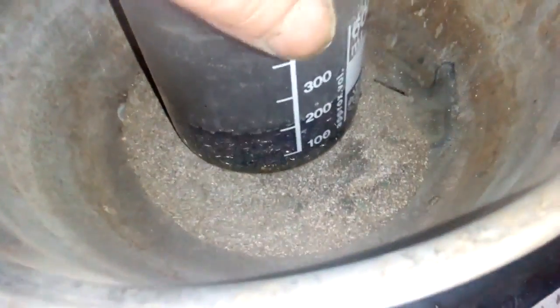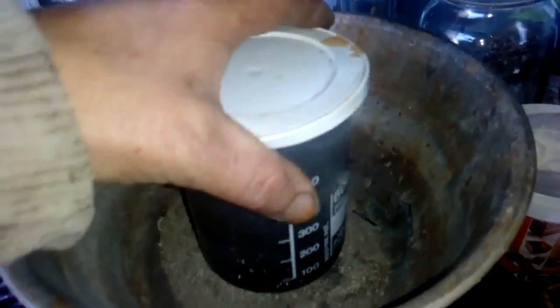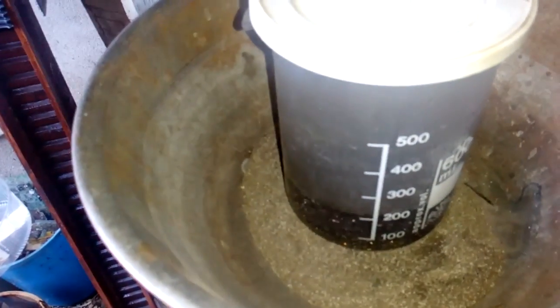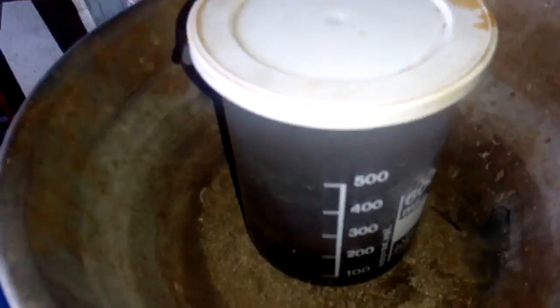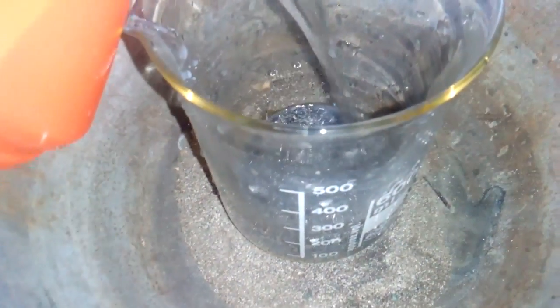So after the wash with the hot HCl we got that purple HCl saturated liquid, and we removed most of that tin and lead. So now we're gonna rinse that with hot water and prepare that for some Aqua Regia. We rinse that a couple of times with the water. Now we will make some poor man's Aqua Regia.